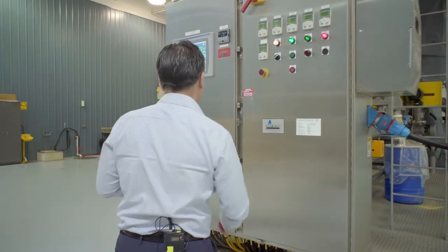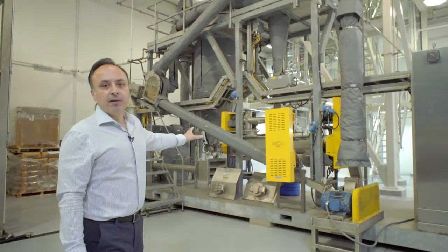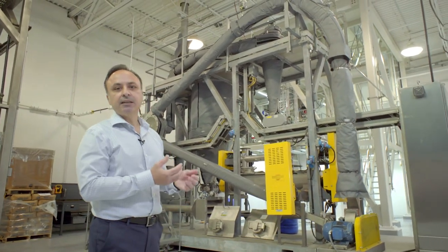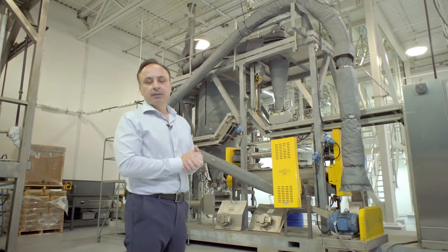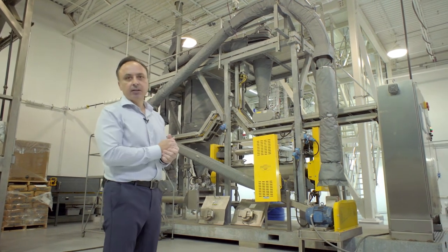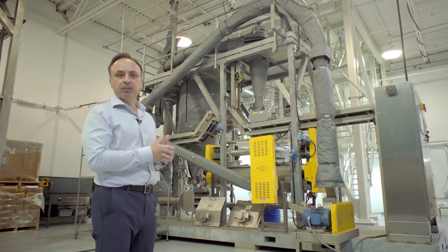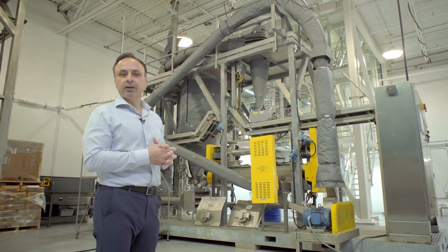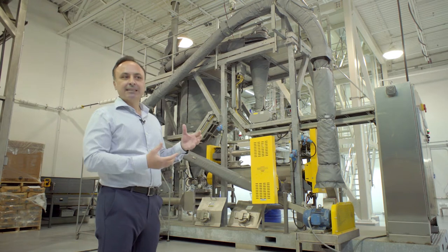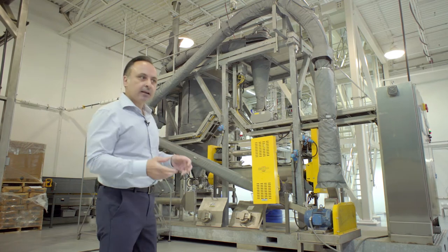Here's an overview of the ring technology. There are a variety of components consisting of a mixing section, a disperser, ring dryer, and a manifold. Unlike other technologies like a spray dryer, the ring dryer takes wet cakes, paste, and wet granules, and dries those materials into a fine powder. When the material is very sticky or wet, it is introduced into a mixer — a twin-shaft paddle mixer — which takes the wet cake and distributes the moisture over a larger surface area.